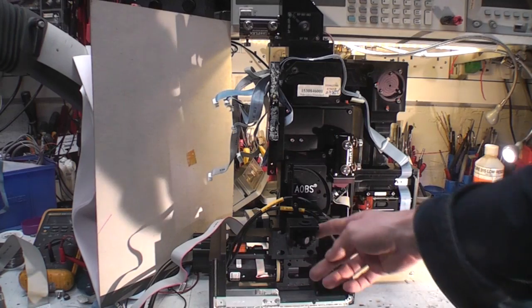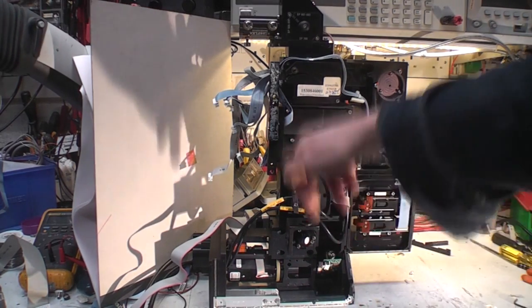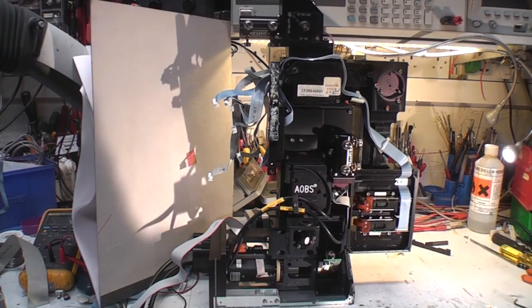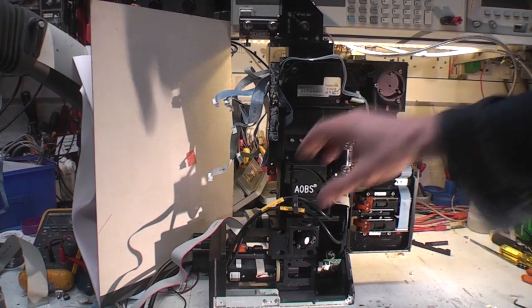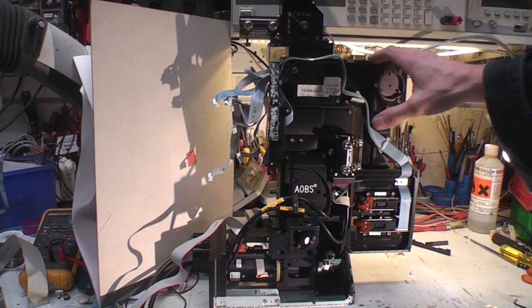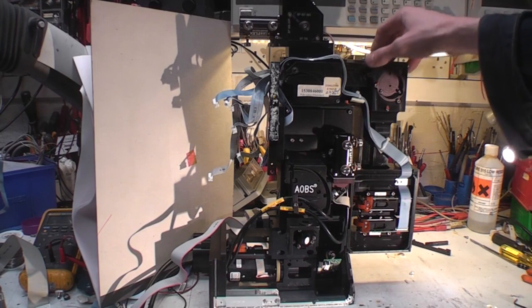There's also a piece that comes out forwards here, and then there's sort of an angle that pointed up this way, so I'm not sure if that's another entrance port for another device or detector or some other option, but not quite sure. Unfortunately I can't find a drawing that exactly corresponds to this, but I think that's sort of roughly right, so I think we need to dive in and see what's going on in this thing.